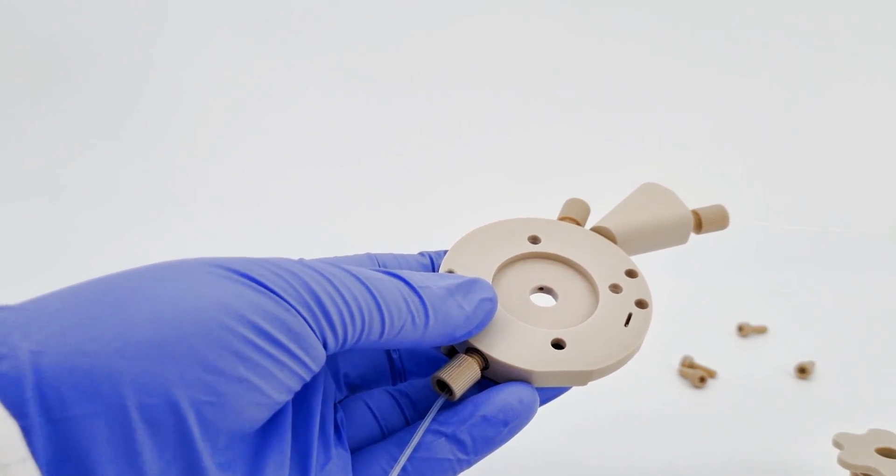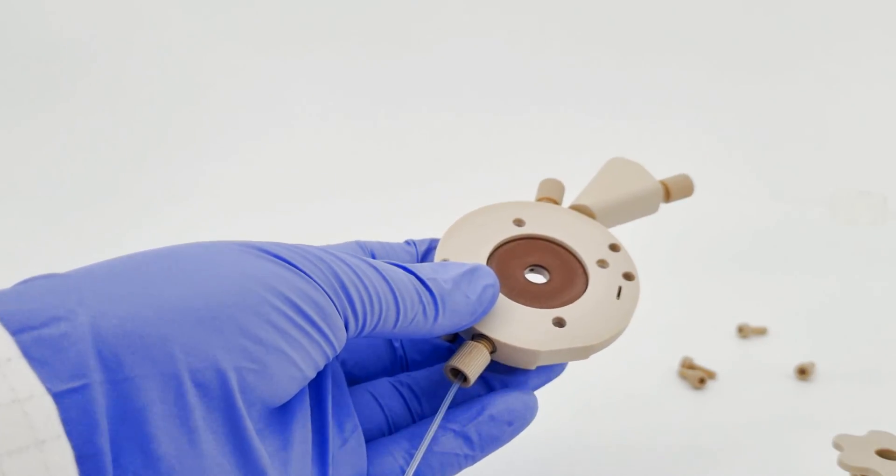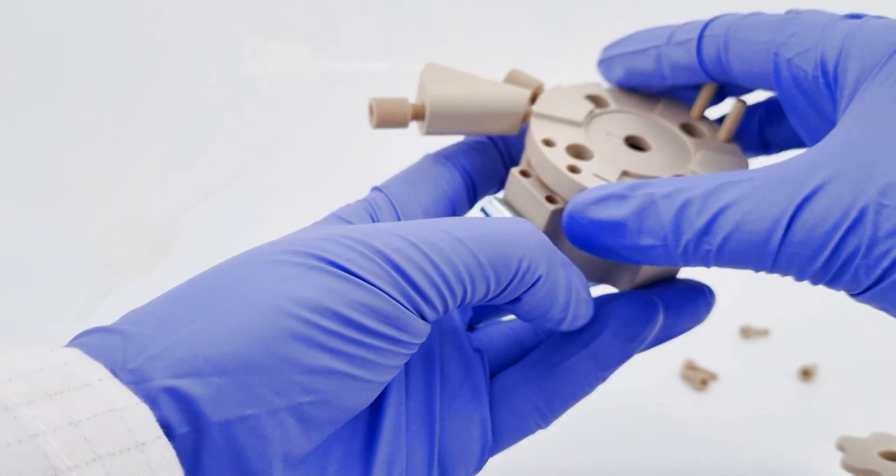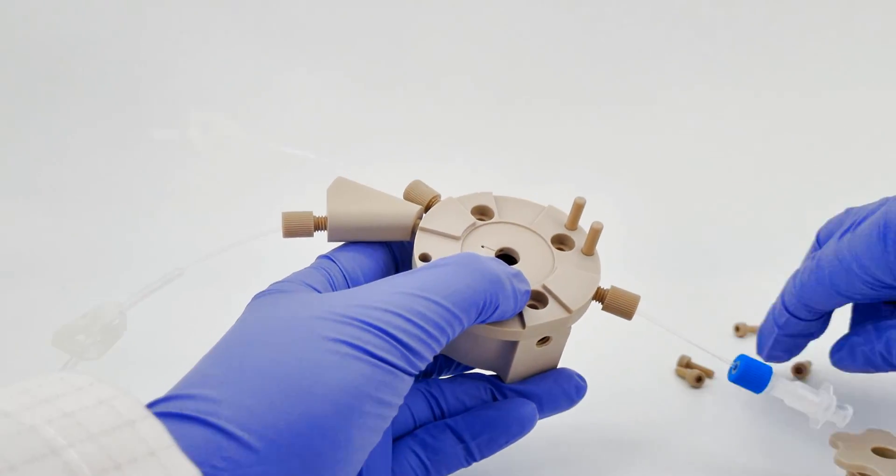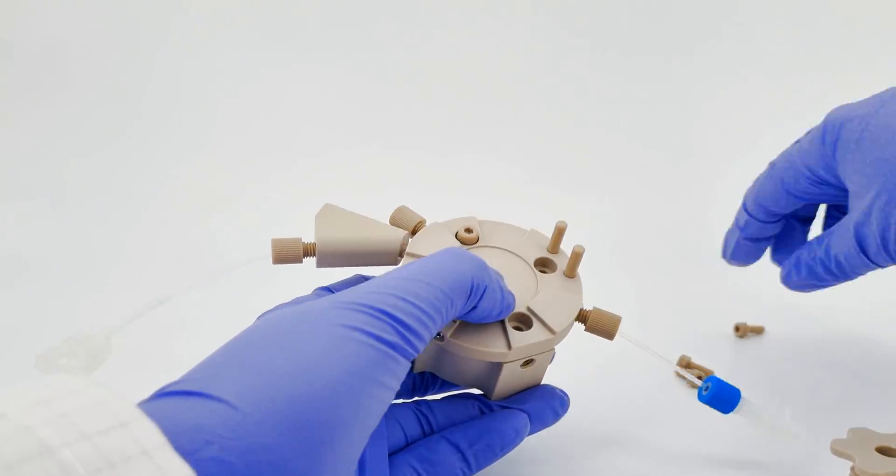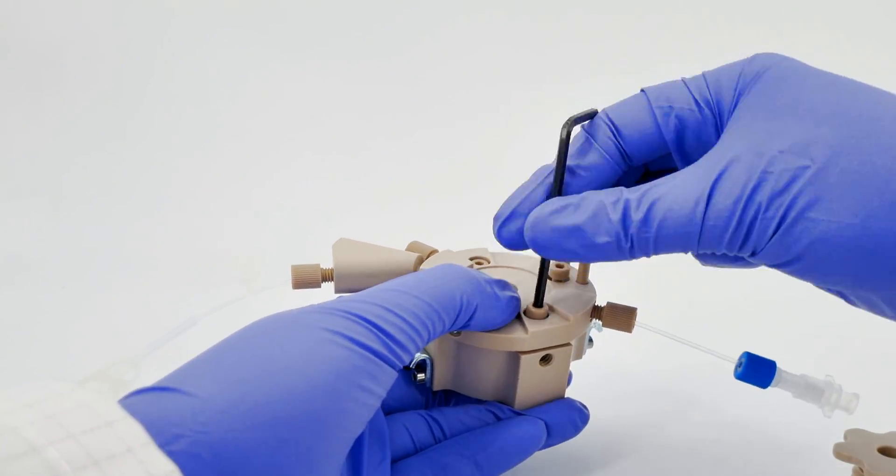Introduce a clean gasket as a replacement. Position the plate back onto the cell. Align the plate utilizing the alignment holes and proceed to screw it back into place. It is recommended to tighten the screws in a cross pattern, ensuring even pressure distribution over the gasket.